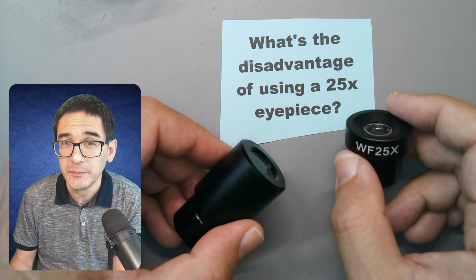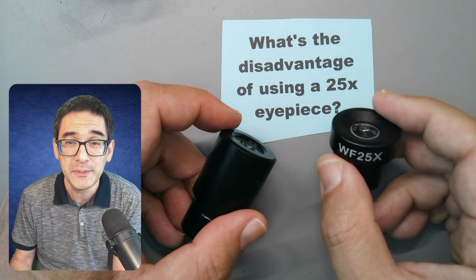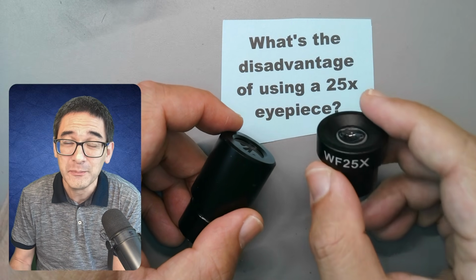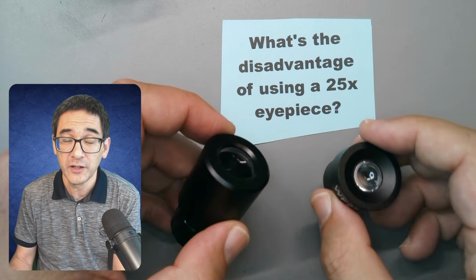But actually, the issue is a little bit more complicated than that, and there are a couple of cases where even a 25 times eyepiece actually has a few advantages. Now, I think not huge advantages, but maybe there are cases where you indeed might want to use one of those. So in this video, I would therefore like to do the following.